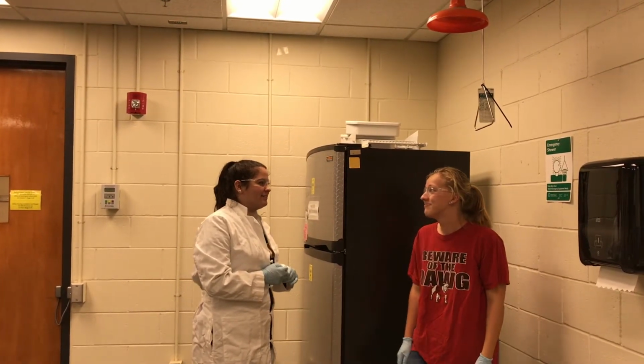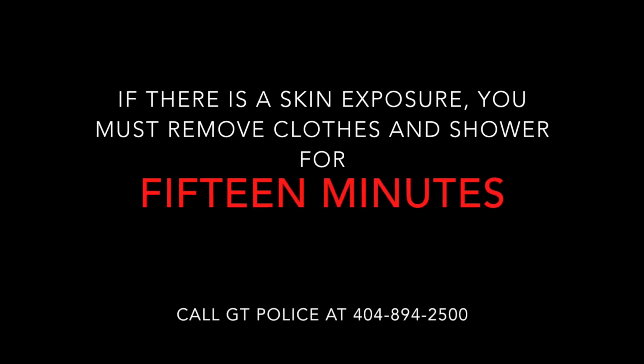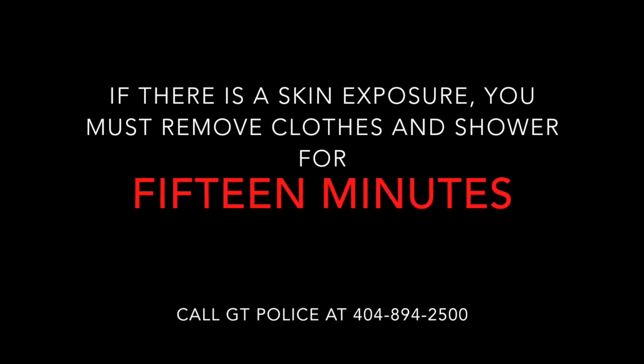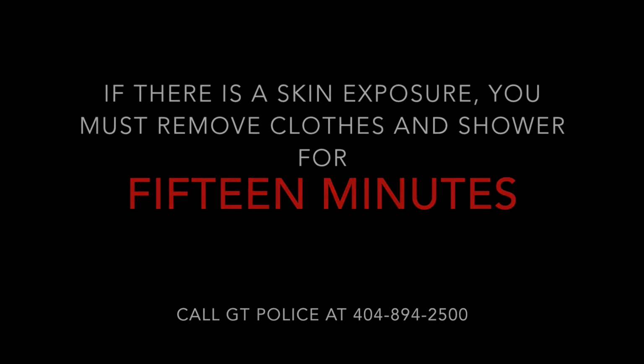I'll count for you. Make sure the shower lasts for 15 minutes. Once again, call GT Police so that the victim receives proper medical attention. If you are helping the victim, find out what chemical they were splashed with if possible, and print out 4 copies of the SDS sheet for that chemical.